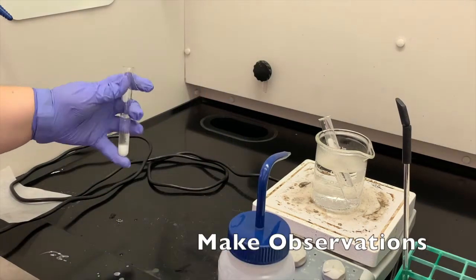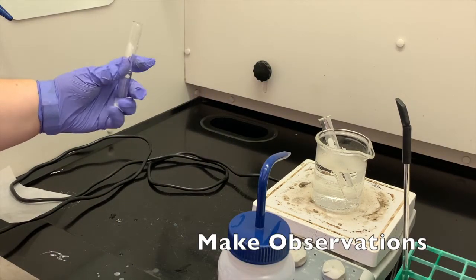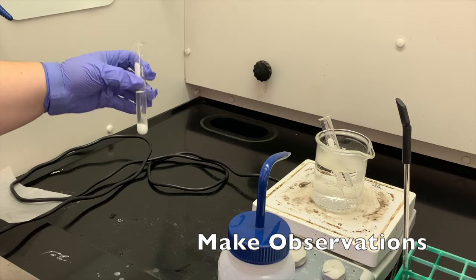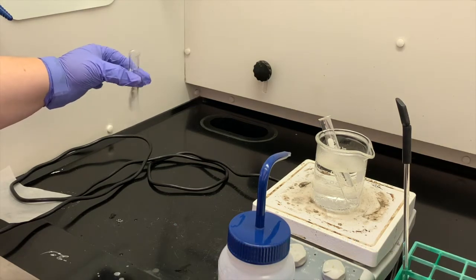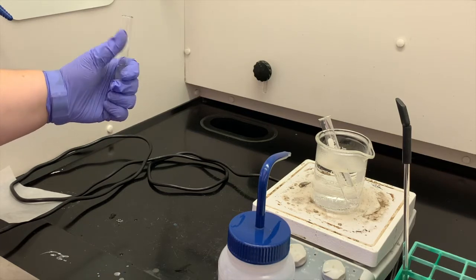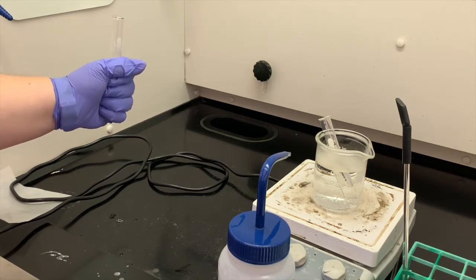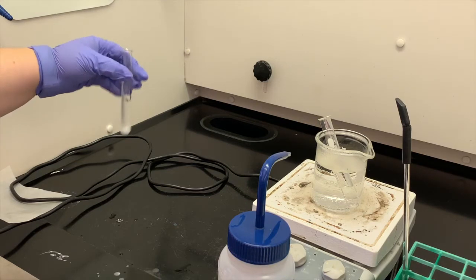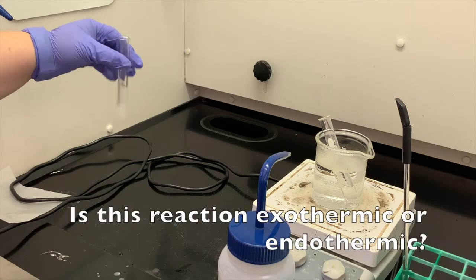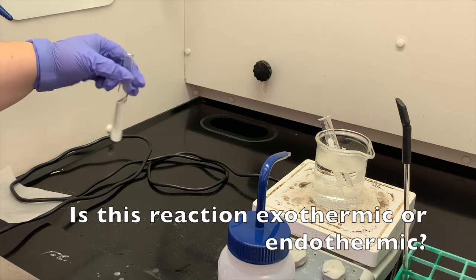So I may have not used a big enough test tube, but right away when I hold it down here I can feel that this is getting colder. Okay, so I'll keep trying to add water to that to try to dissolve all these crystals, but yeah, when I hold it like this in my hand I can tell that that's gotten colder. From that, you want to be able to decide: is this reaction exothermic or endothermic?